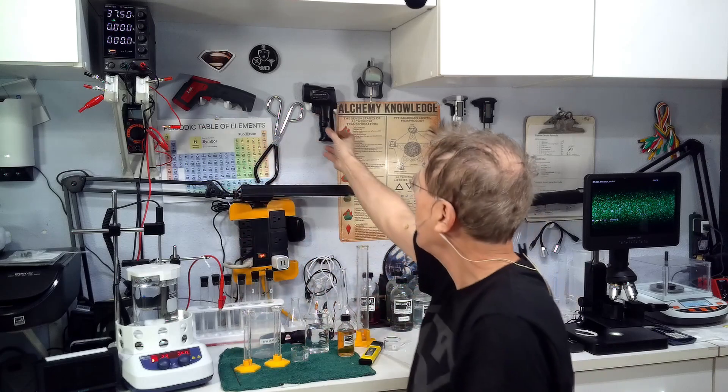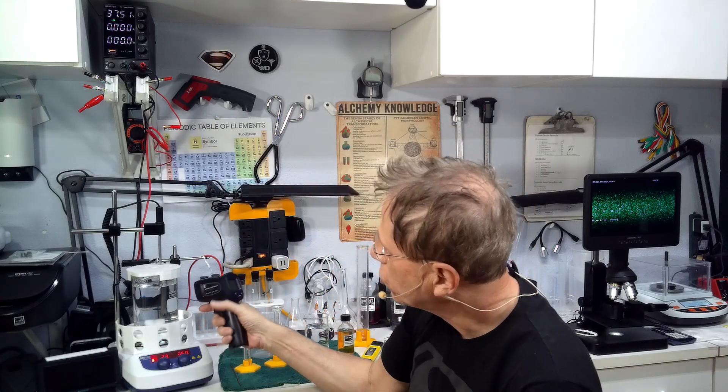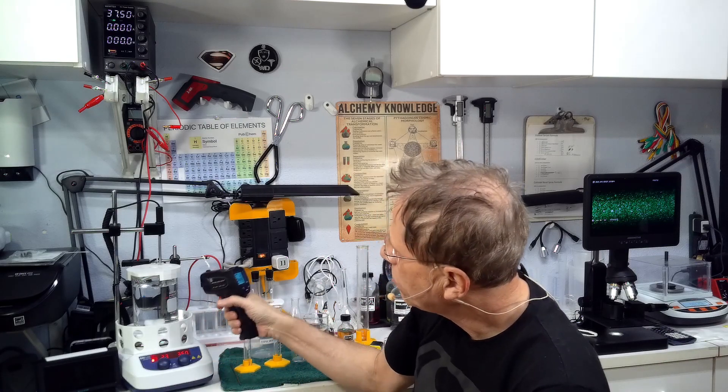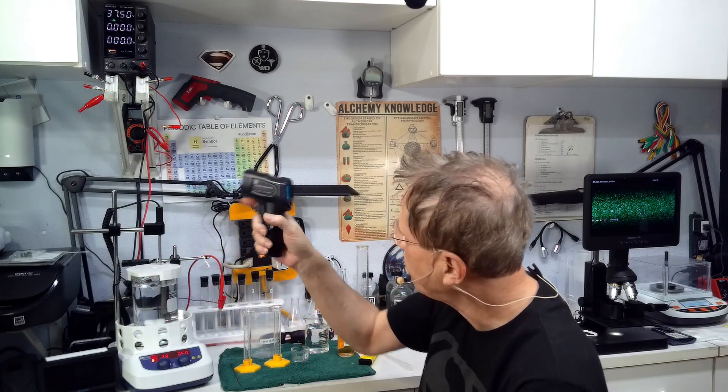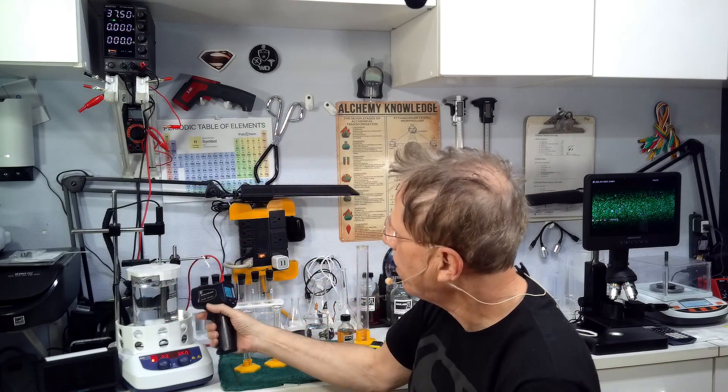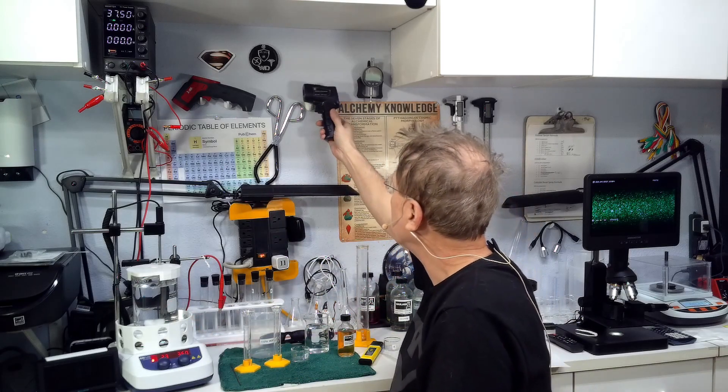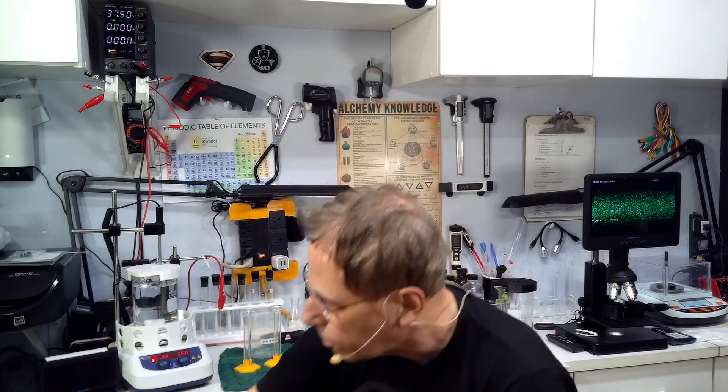If you don't have an automatic temperature probe, you can heat it in the microwave to get it up to 80, use your laser, then turn your heat on to maintain it and use your infrared laser from time to time to check the temperature.